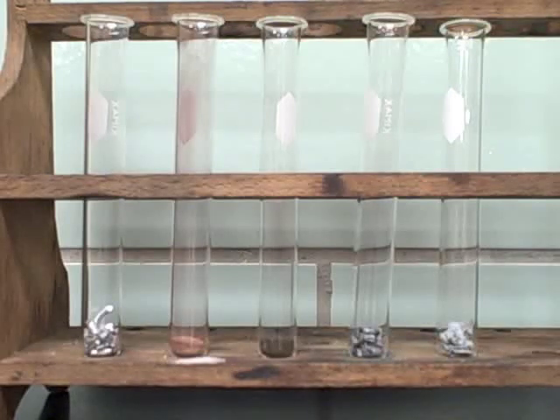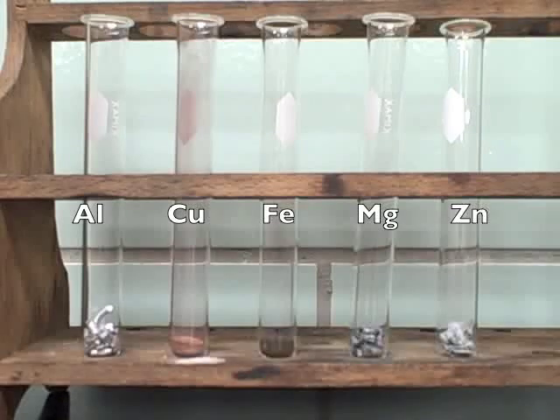From left to right, the metals are aluminum, copper, iron, magnesium, and on the end, zinc.